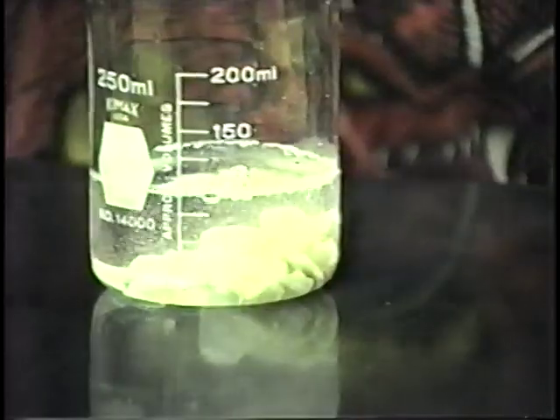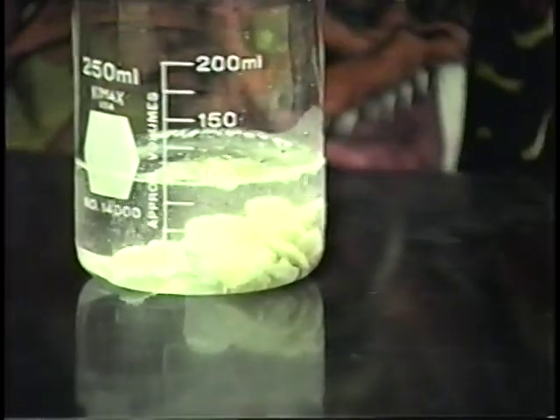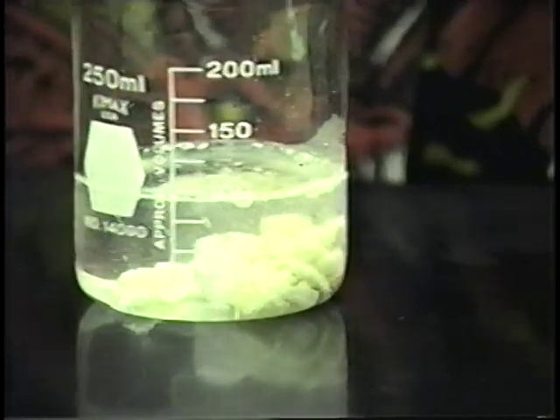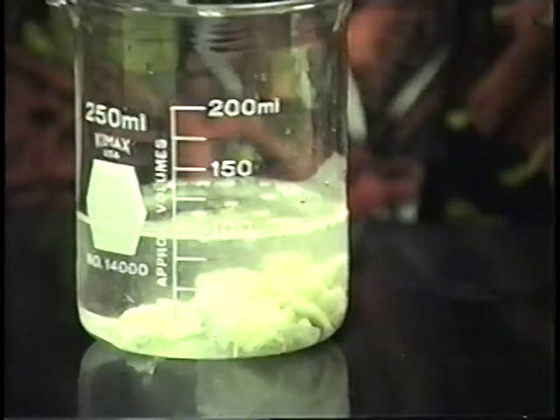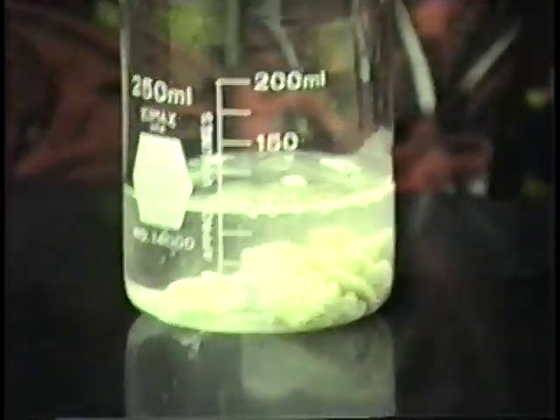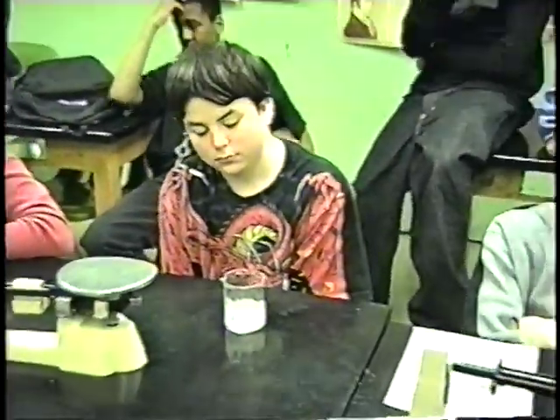All right, now Matt, take a look there. What's happening to the rocks right now? Yes, there are bubbles of gas that are coming out of the rocks, and we can see them right here. One of the better times that we've been able to see this. Now, here's something we haven't really talked about, and I'm not going to give you a duh if you miss it, because we've never actually discussed it.